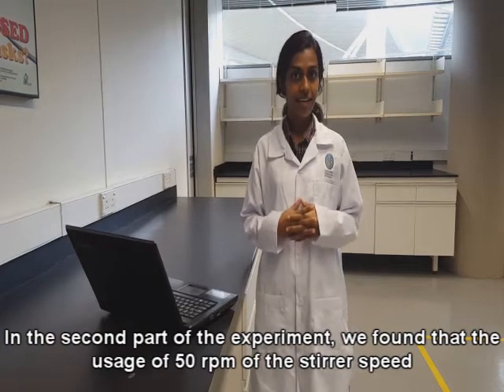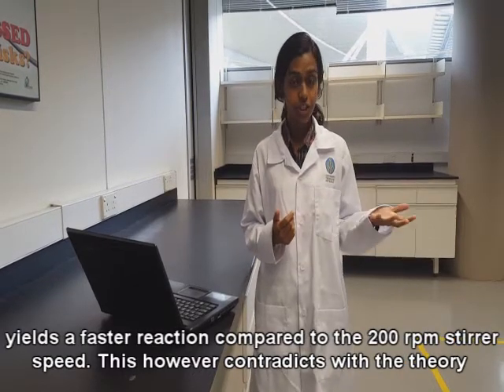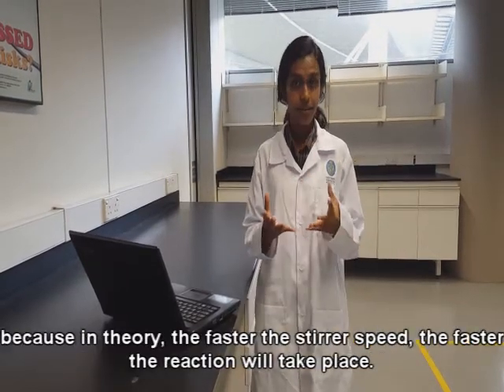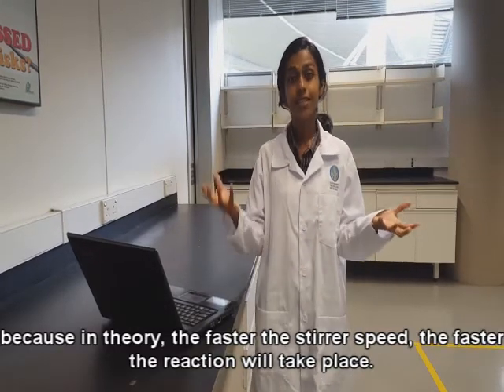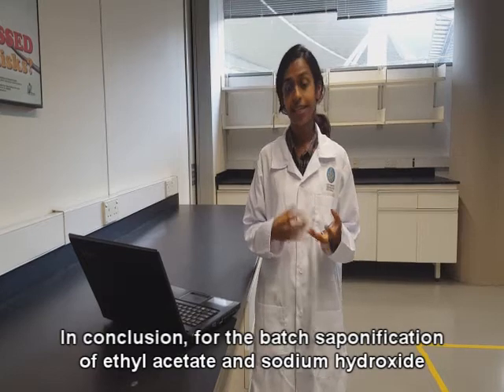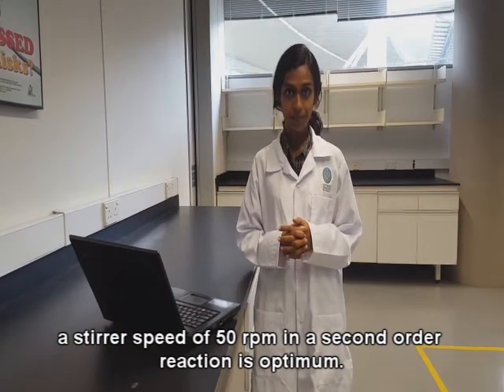In the second part of the experiment, we found that the usage of 50 rpm of the stirrer speed yields a faster reaction compared to the 200 rpm stirrer speed. This, however, contradicts with the theory because in theory, the faster the stirrer speed, the faster the reaction will take place. In conclusion, for the batch saponification of ethyl acetate and sodium hydroxide, a stirrer speed of 50 rpm in a second order reaction is optimum.